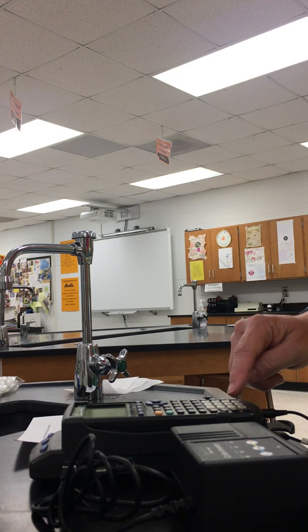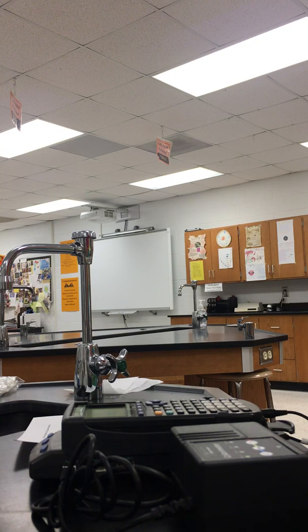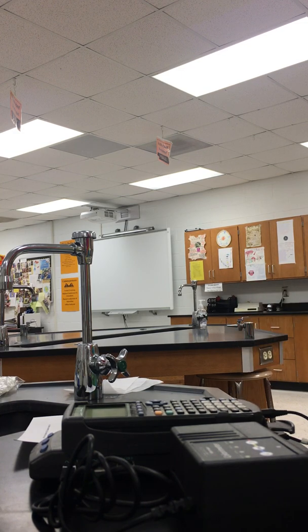and then it tells me to pick a channel, and number 1 is absorbance, so I'm going to put channel 1. I'm going to let it read for a few seconds, and then it tells me to press enter to 0 it, so I'm going to press enter, and we'll see if it will 0.